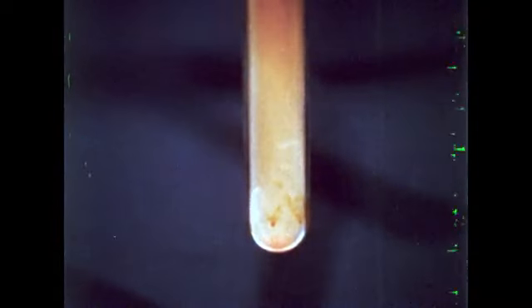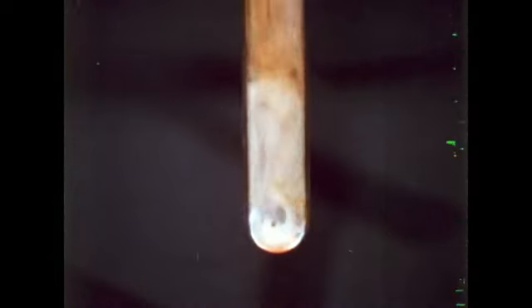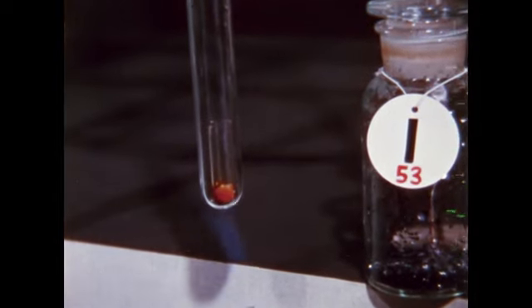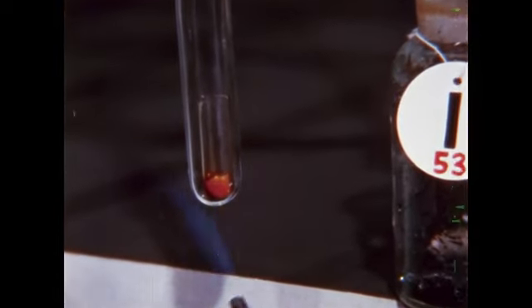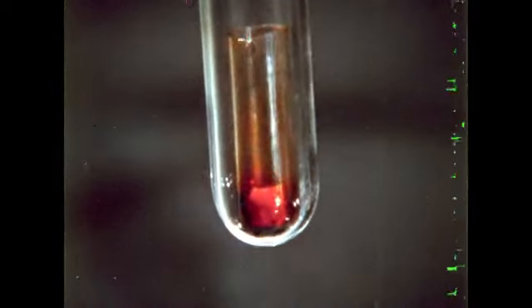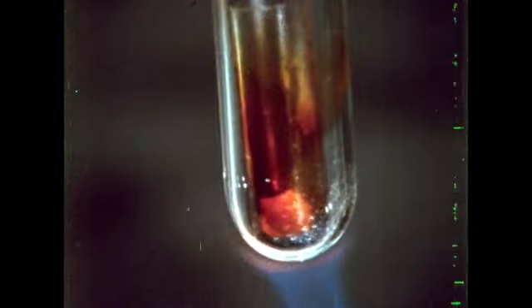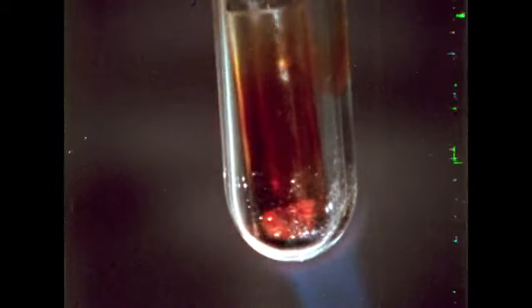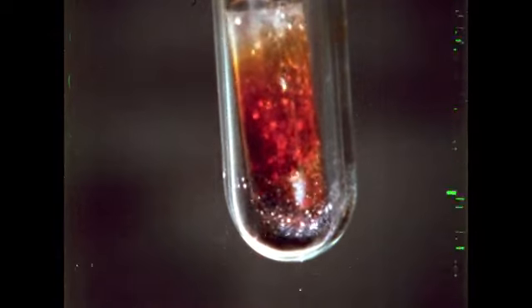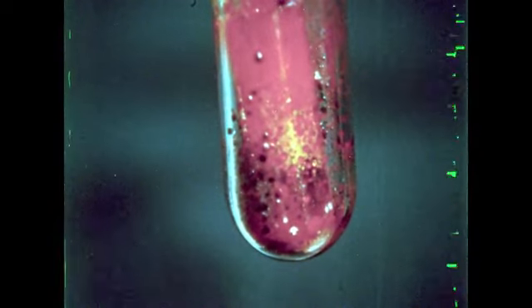Here is bromine. It also reacts with phosphorus. The reaction speeds up when we heat the tube. Iodine is not a gas at room temperature, so we place the solid in the outside tube, with phosphorus in the inside tube. Upon warming, the iodine vaporizes. When the iodine vapor enters the inside tube, we note a reaction begins. Further heating causes a more vigorous reaction, leading after a few moments to this red and orange product.